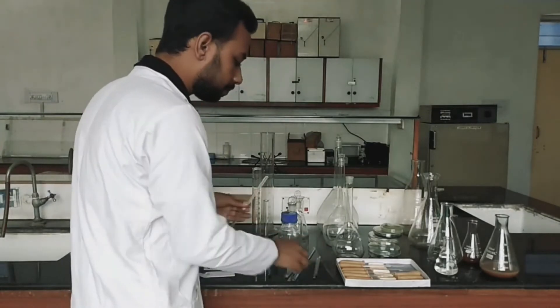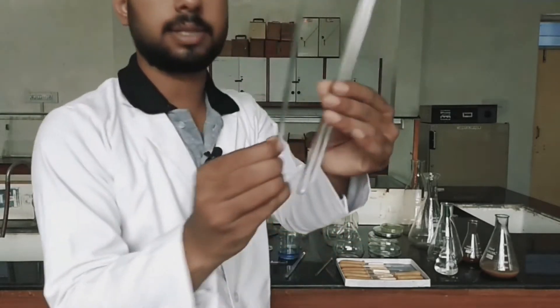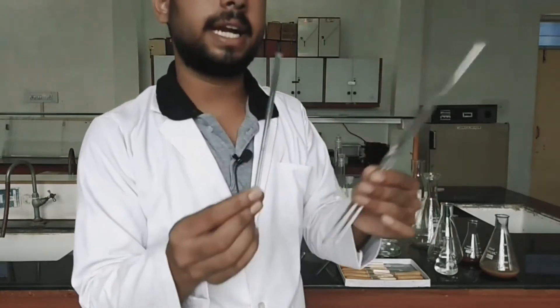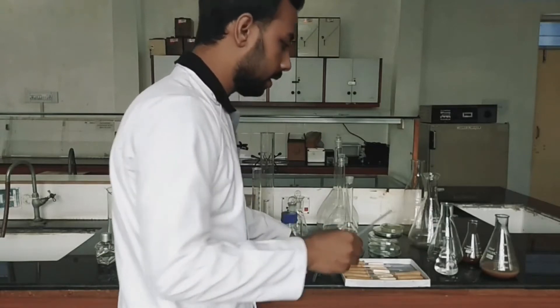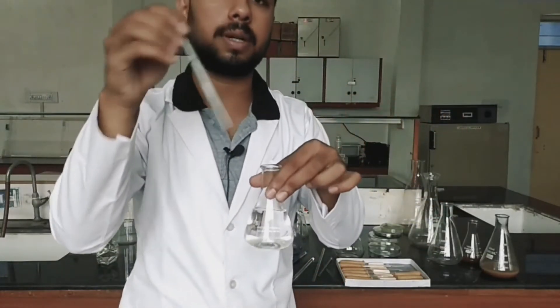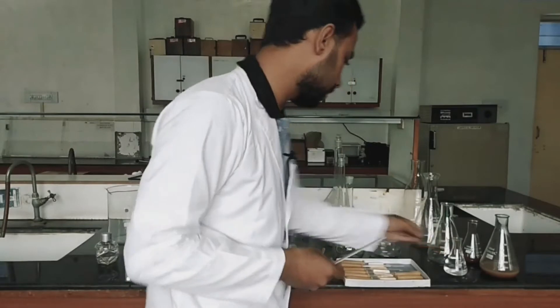Next is the glass rod. There are different sizes of glass rods available — small and thin ones, and larger ones. Glass rods are used for dissolving purposes. If there is material in a container that I want to dissolve, I just use this glass rod.